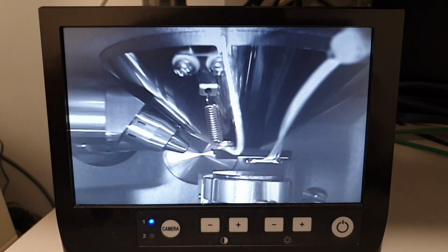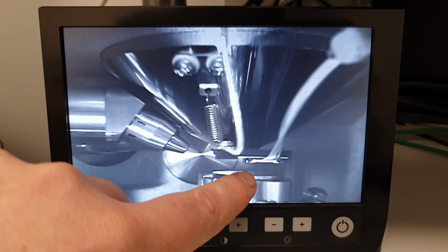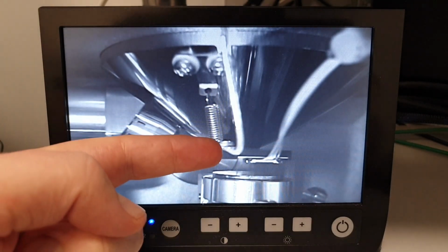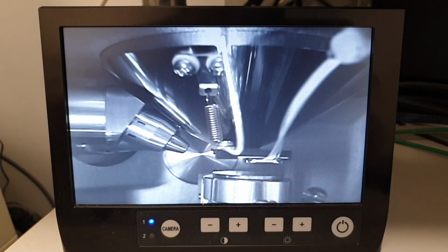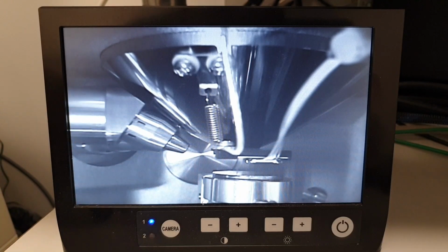This is the first optimization, and this is the most important to ensure that you are getting the X-rays from your sample through to the detector. Of course, operating at a longer working distance from the objective lens and from the detector will impact the SEM image, but we are optimizing for EDX, so we want to favor X-ray intensity.